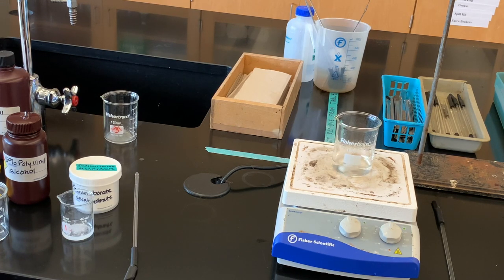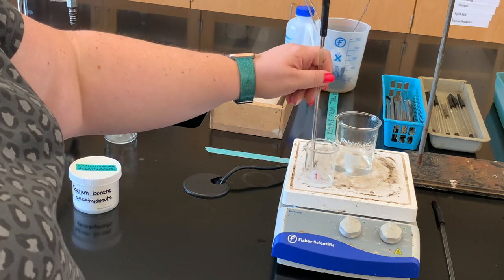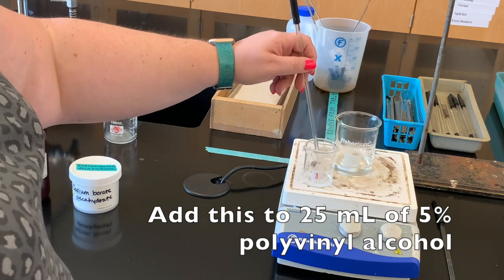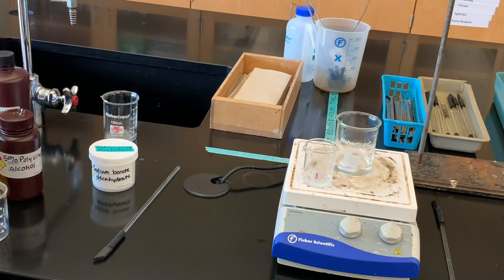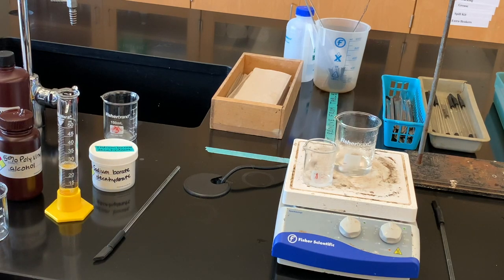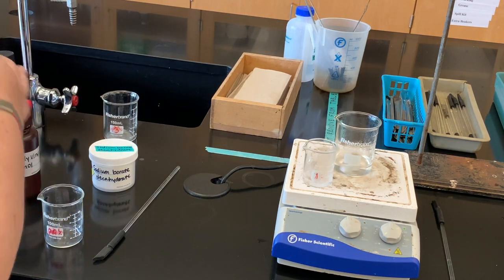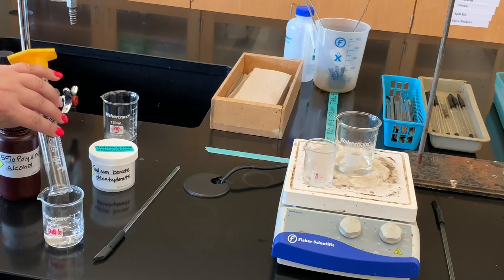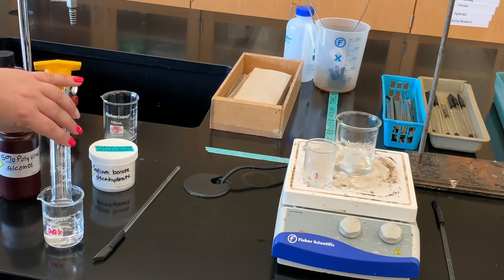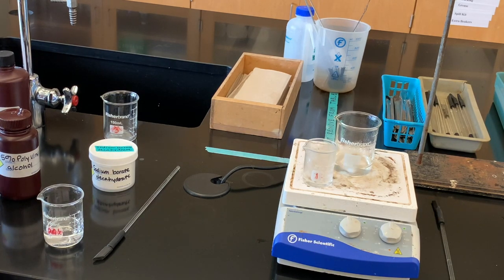I'm going to add that to about 25 milliliters of the 5% polyvinyl alcohol solution. I've measured it out in my graduated cylinder and the procedure says to put that in a 100 milliliter beaker. We're waiting for the sodium borate decahydrate to dissolve, then we'll add it to the polyvinyl alcohol. I'm going to put gloves on because we're going to take the polymer out of the beaker and handle this cross-linked polymer to look at it more closely.